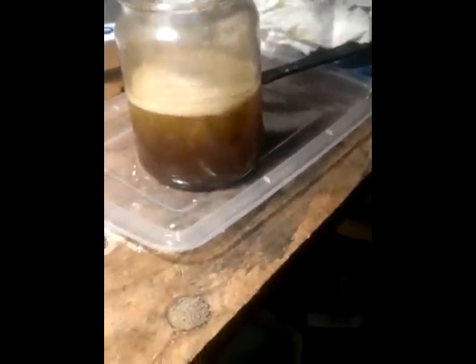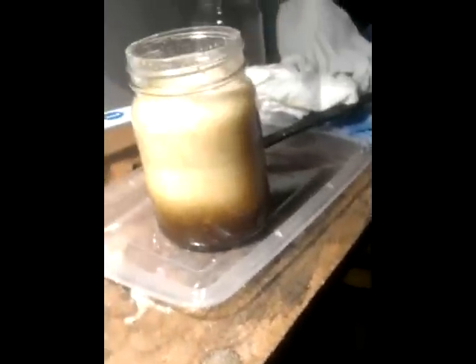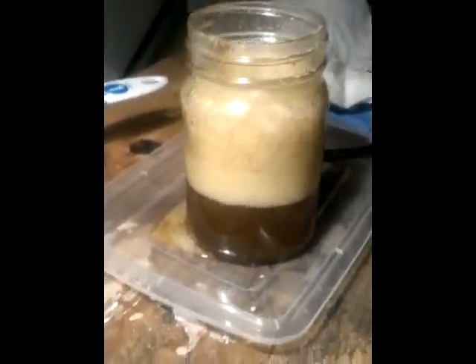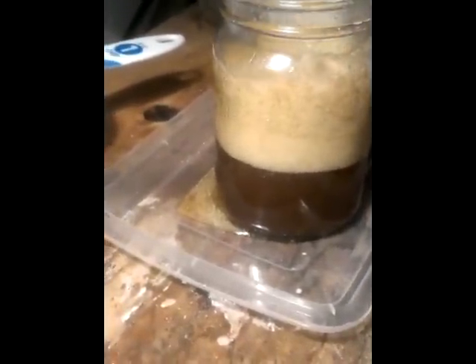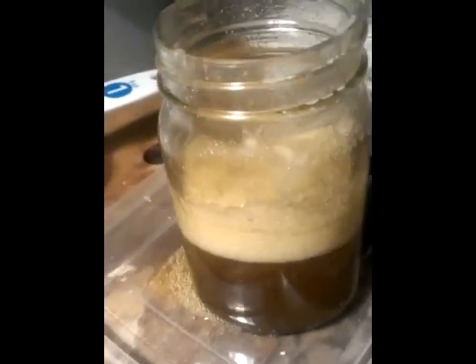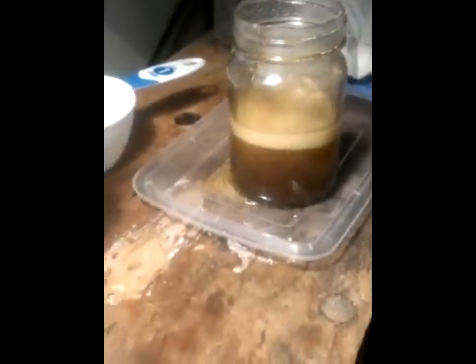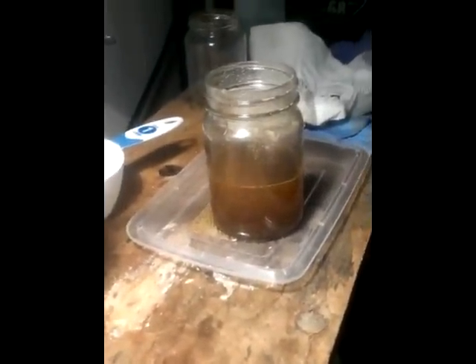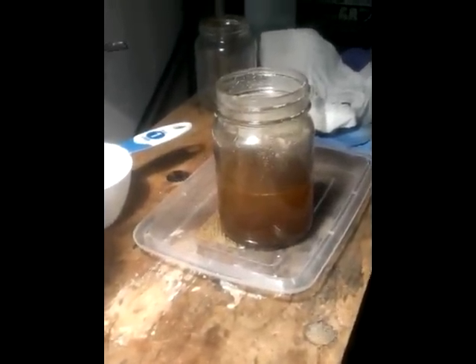You can see it immediately. And keep it in plastic — that's why I have this sitting in a tray. I always keep that in a plastic tray. So if you get a boil-over when you do that, you can recover it — see, it collects it down there. Then you can just recover that and put it back in.